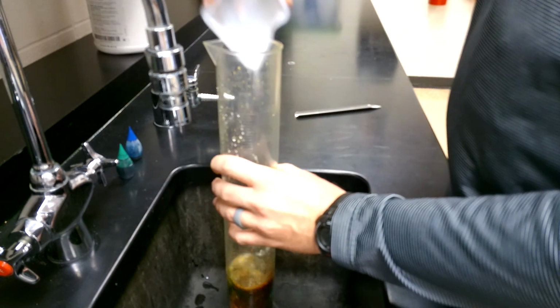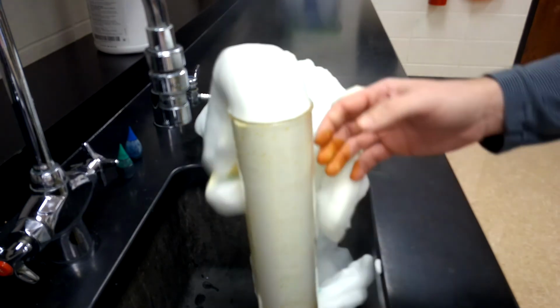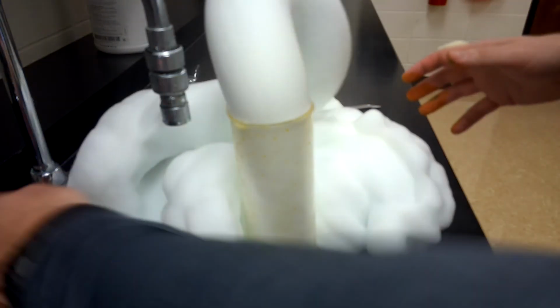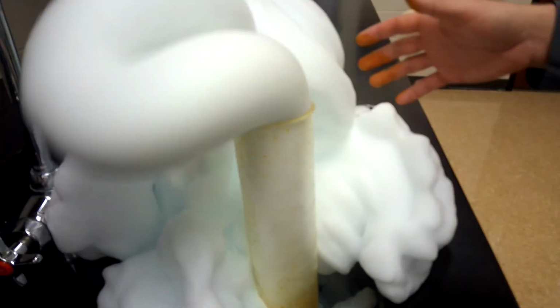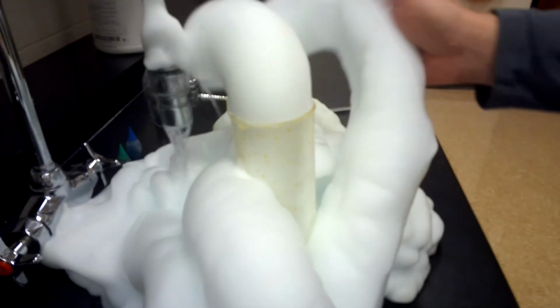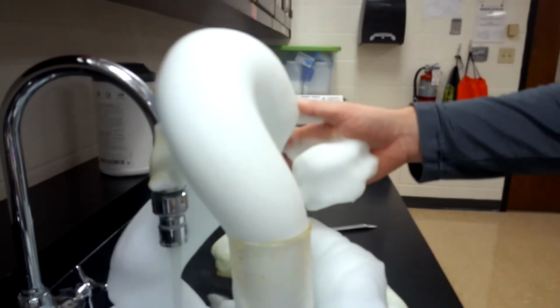So here we go, potassium iodide into 30% hydrogen peroxide. And I would say that's impressive enough for my liking. I might still have a mess going on here. So there you go. All I did was I increased the concentration of hydrogen peroxide. You can see the steam coming off. This thing is still going crazy.